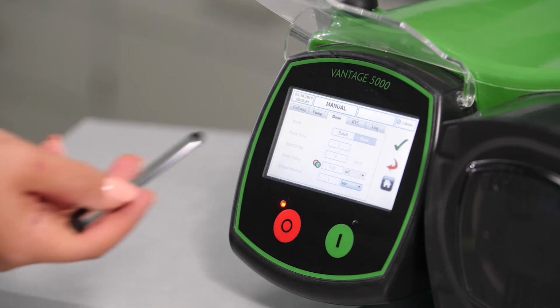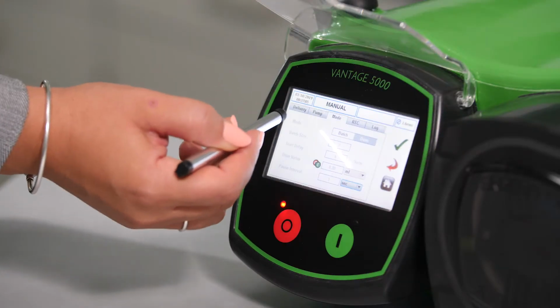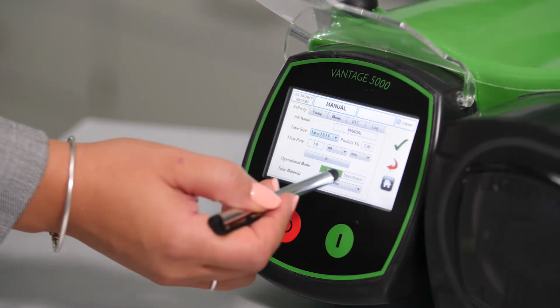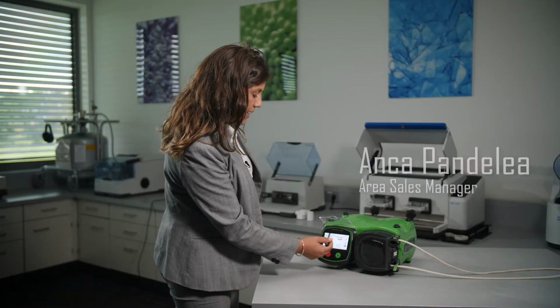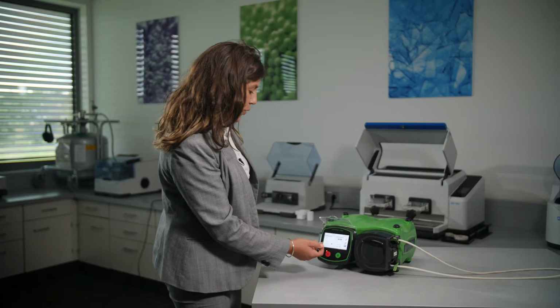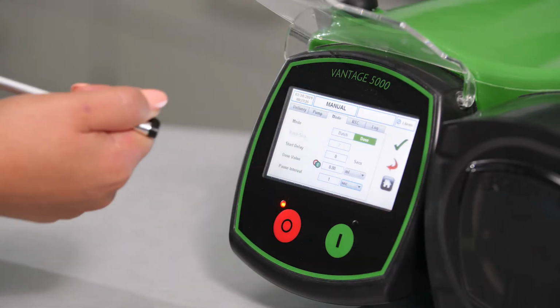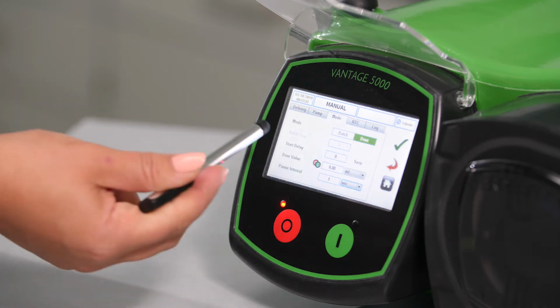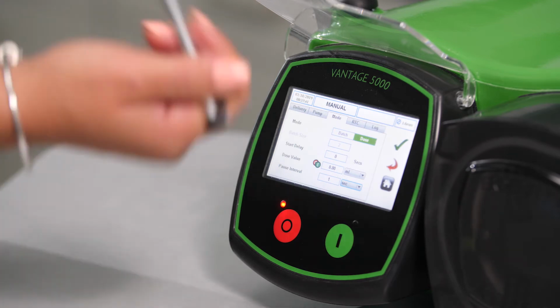Here, as you can see, it's a gray screen, which means that in the delivery tab we selected flow mode. But now if we select dose and batch mode and go back again to mode, we can select everything here in the mode tab. We can select mode, which is batch or dose. We can select the start delay, we can select the dose value, and we can select the pause interval.